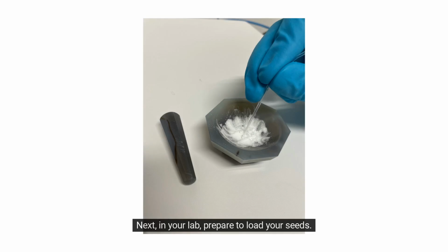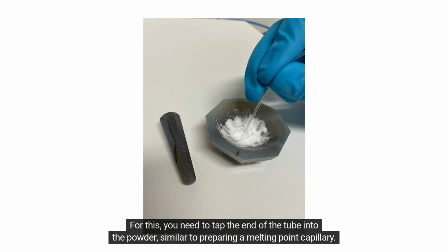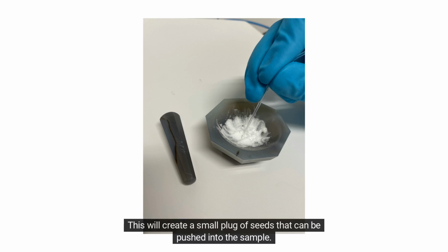Next, in your lab, prepare to load your seeds. For this, you need to tap the end of the tube into the powder, similar to preparing a melting point capillary. This is best done with fine powder material, so you may need to gently grind the seeds using a pestle and mortar. This will create a small plug of seeds that can be pushed into the sample. Typically you will need a few centimeters of seeding in the tubing.